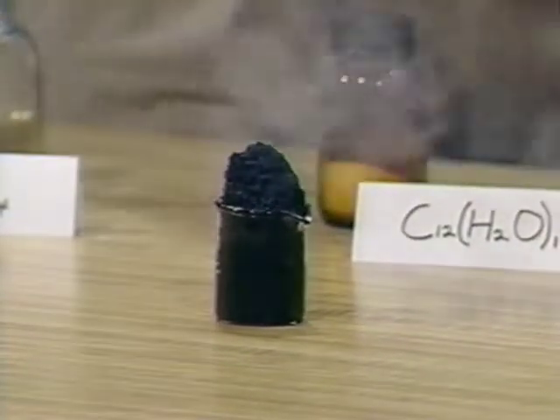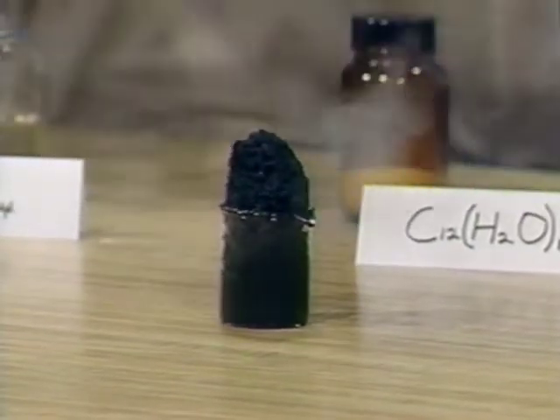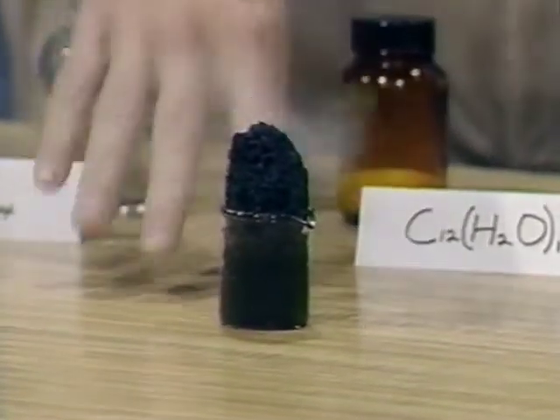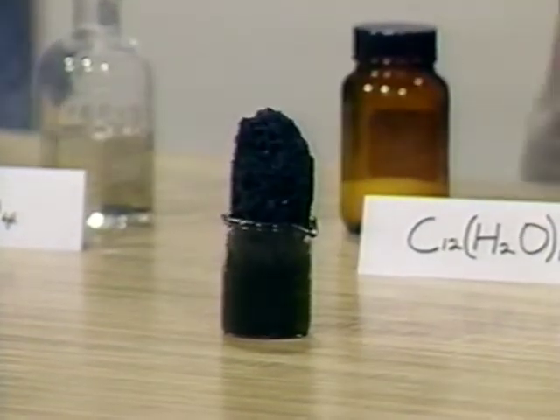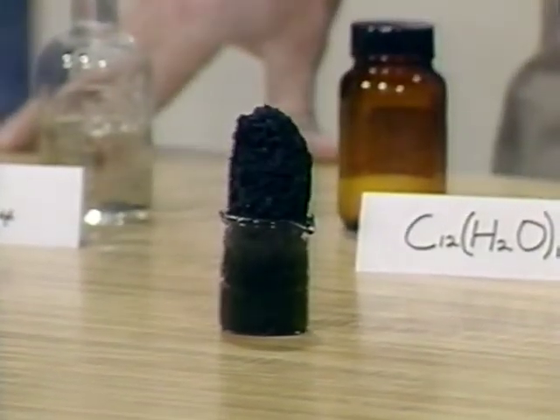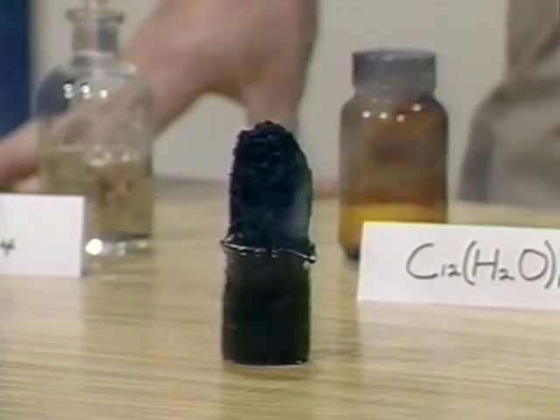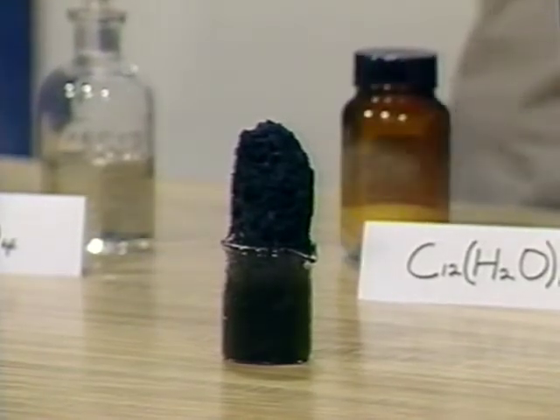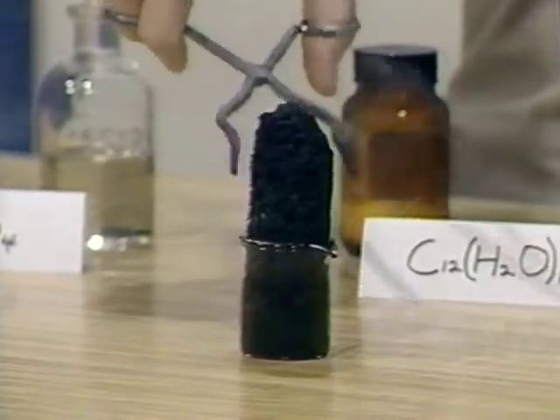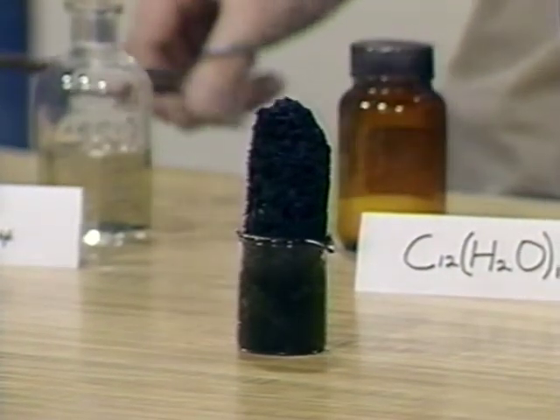And so the sulfuric acid is removing the water from our sugar, and what's left behind is the black carbon. Look at that, and it stinks. It smells like burned sugar, maybe a little worse than burnt sugar. So what we have here is just carbon black, and it does stink. The water has evaporated because of the heat of the reaction.